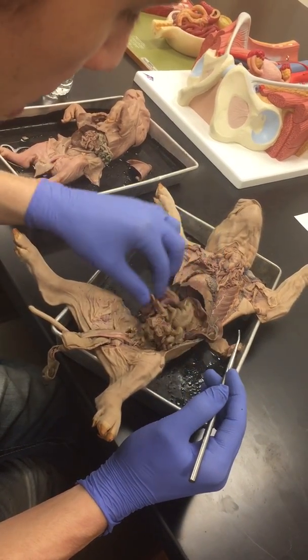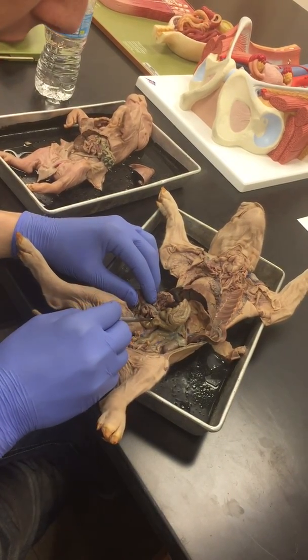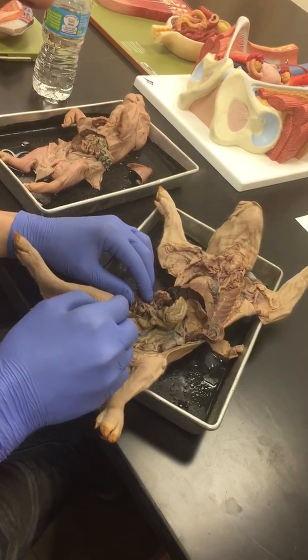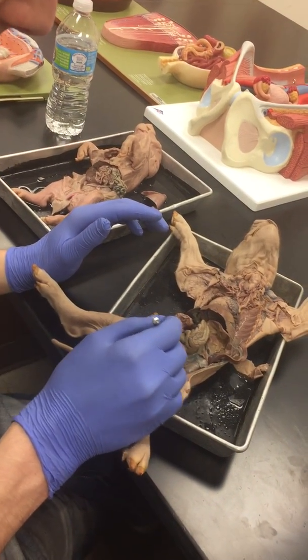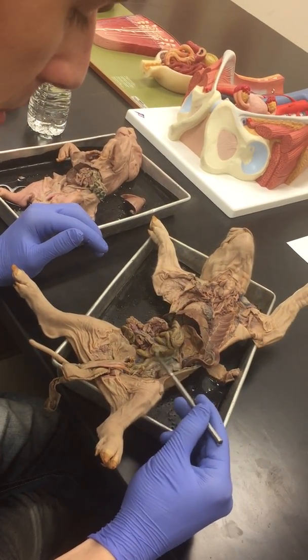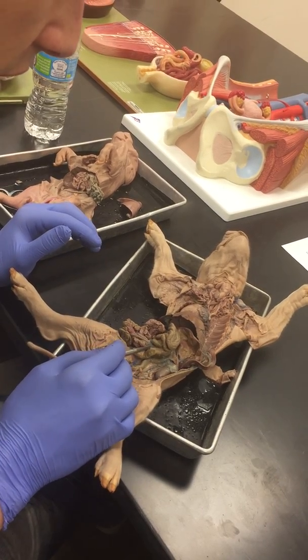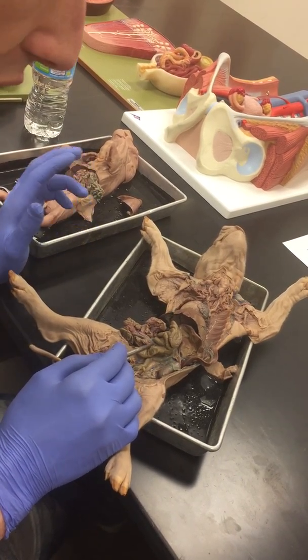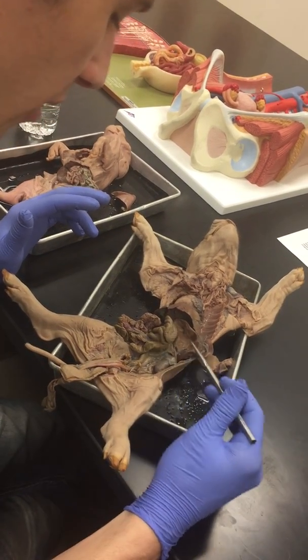So if we continue down the small intestines and follow it down, we can see the end of it, which will extend into the cecum. So really they don't have an appendix, but this would be similar to our appendix. But for the test, the whole thing is the cecum, and the ileum connects to the cecum. So between those, we're going to call this the ileocecal junction, because you can't necessarily see the valve. So you got the ileocecal junction here.